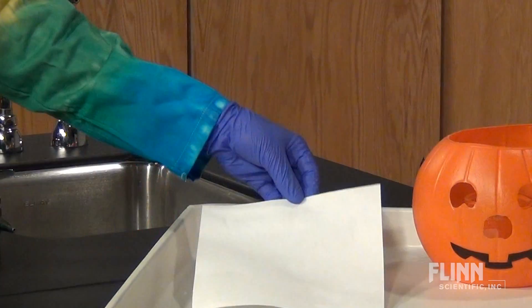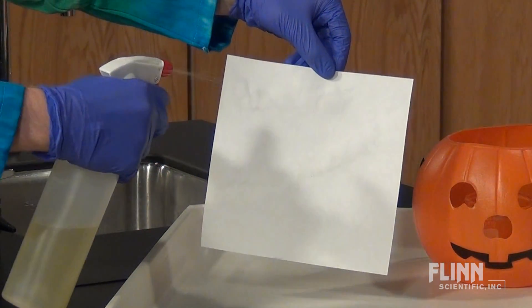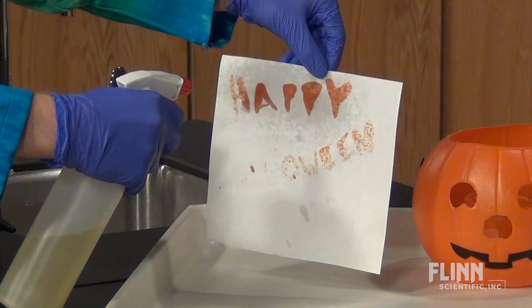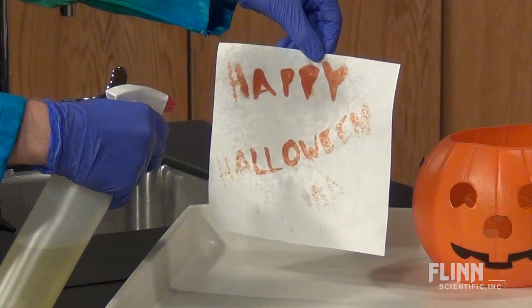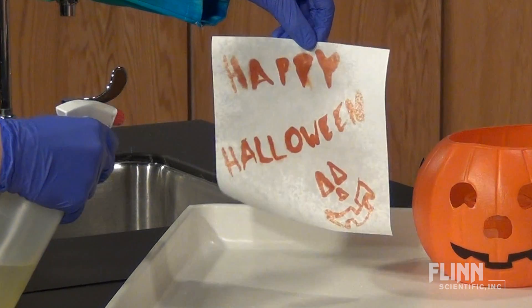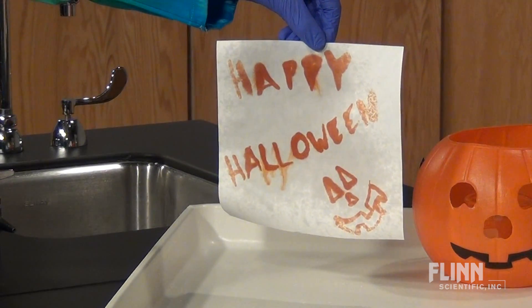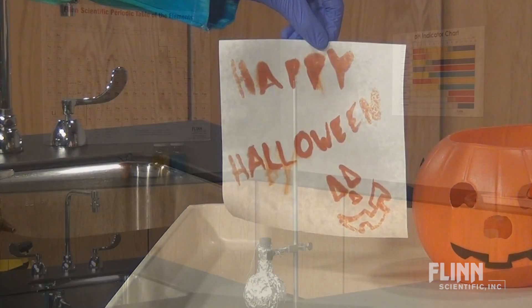Halloween is the perfect time to engage your students with dynamic and spooky demonstrations. Write a message or draw a picture that only appears when a solution is sprayed onto a piece of paper. Students will be surprised to see the blood-red image appear on the page.